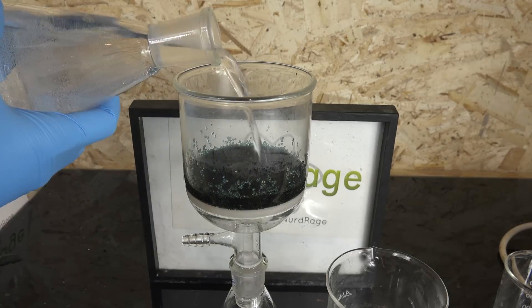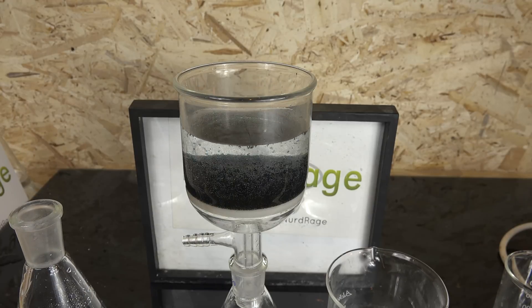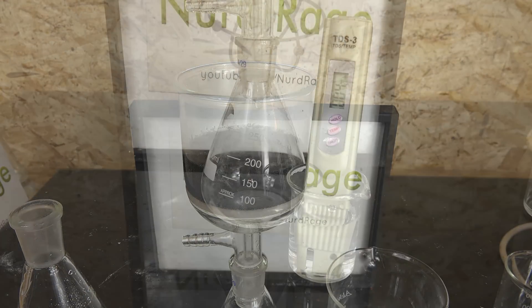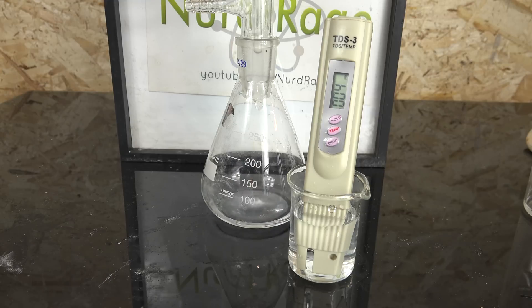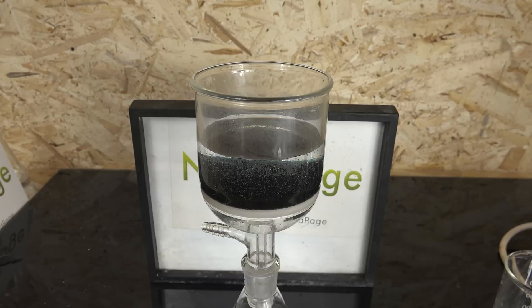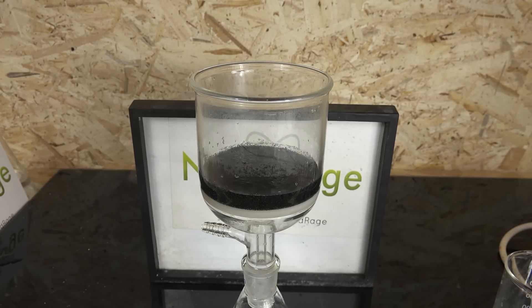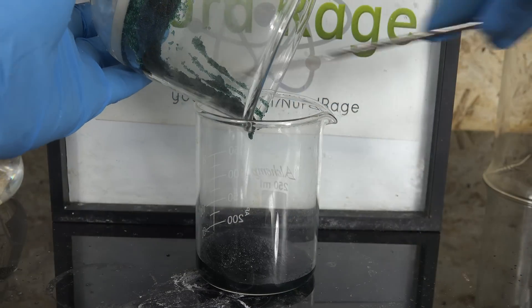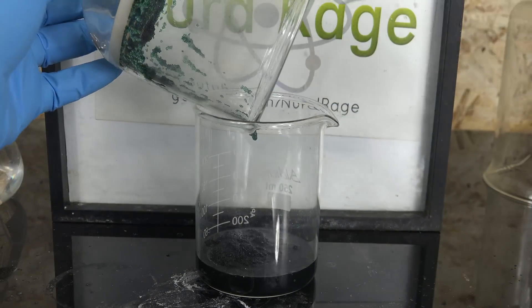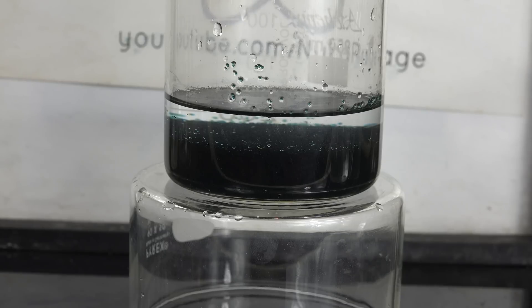However, as an amateur this level of washing is not strictly necessary and is rather wasteful of deionized water. So as long as your filtrate TDS is below the reading of your reverse osmosis water, your resin is good enough and any tiny loss of capacity will be imperceptible. A lot of aquarium enthusiasts just wash a couple of times with water and don't spend more time or water than that. When the resin is as clean as you need it to be, scoop it out and set it aside. There is our fully regenerated and cleaned anion exchange resin under deionized water, ready for use.